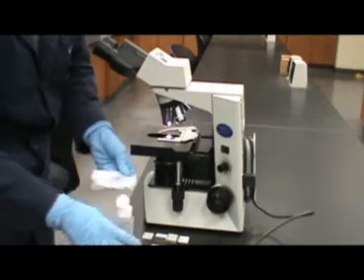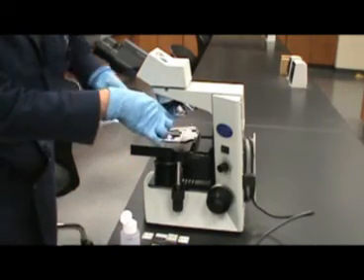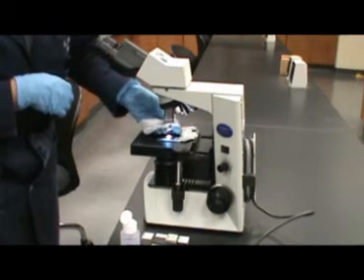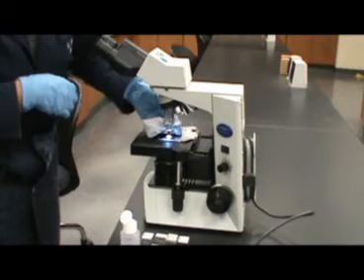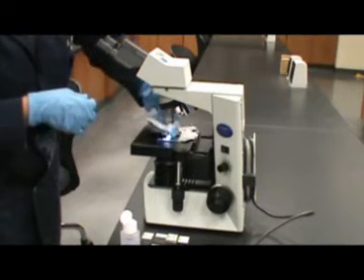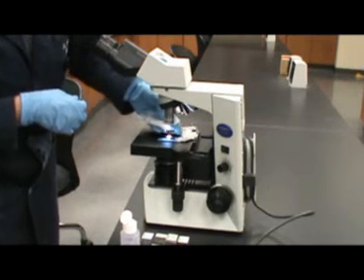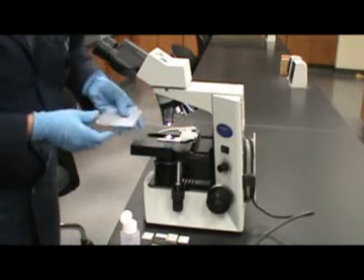Flip the tissue over, add a few more drops of lens cleaner, and now move the objectives over so you can clean the oil immersion. The oil immersion lens should always be cleaned after every use. It is suggested that you clean the oil immersion lens in between each slide if you are observing more than one slide during the use of the microscope.